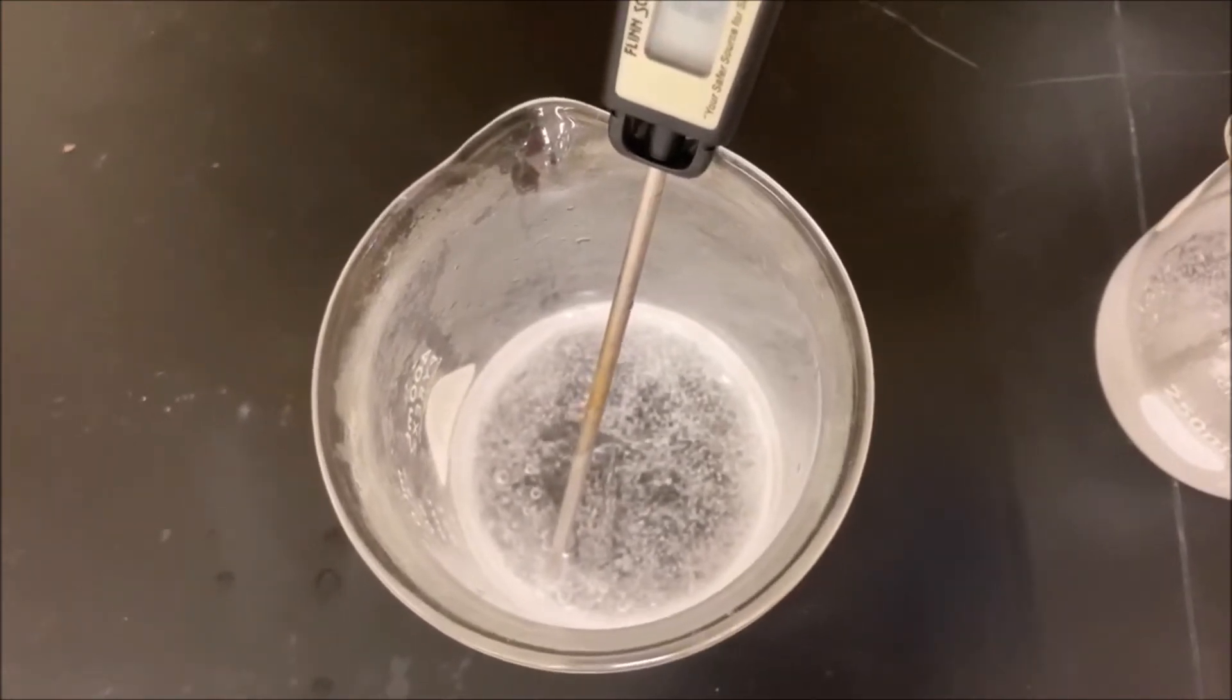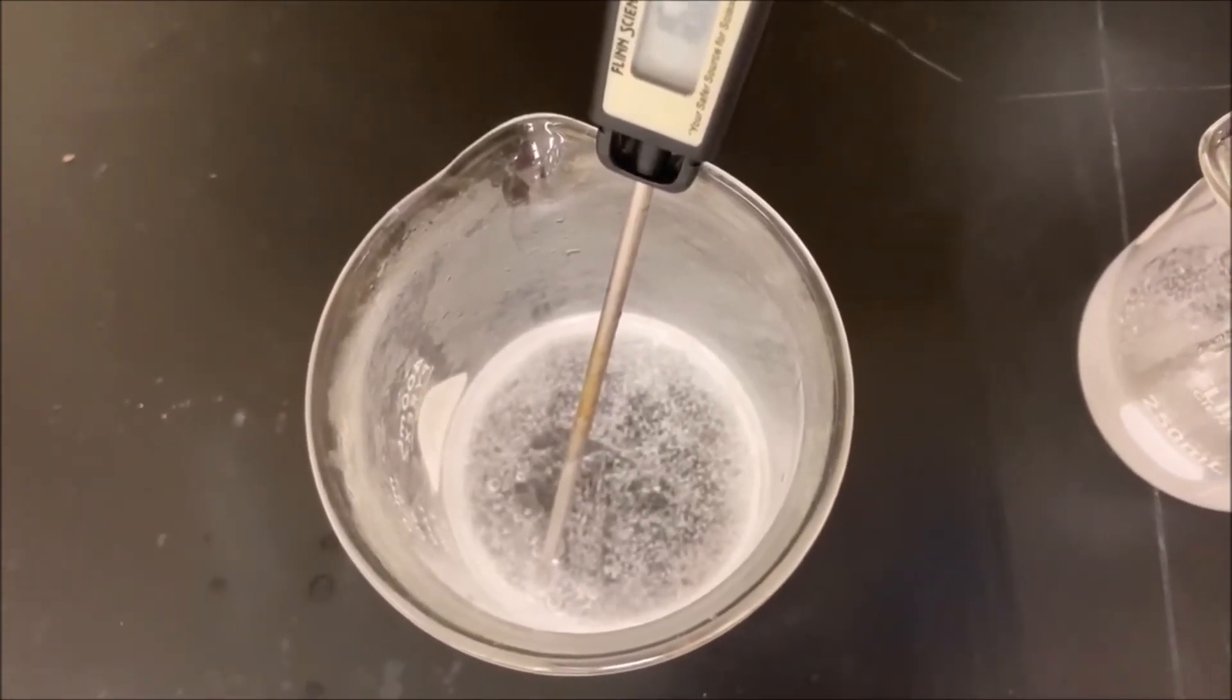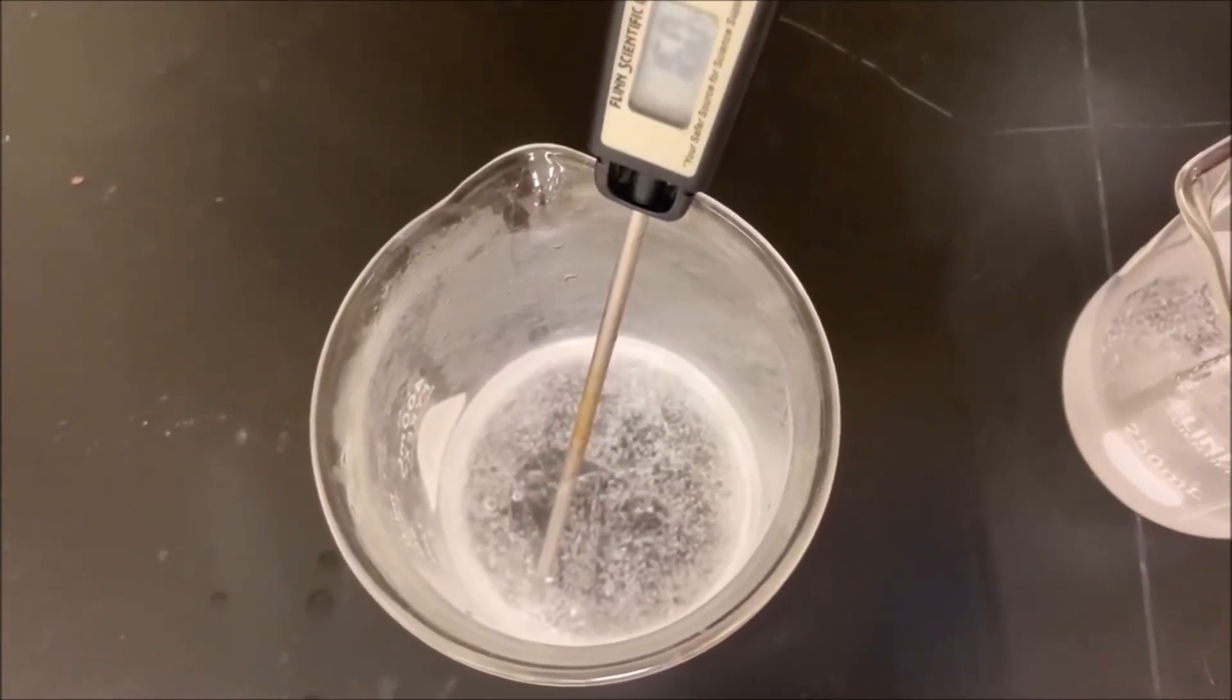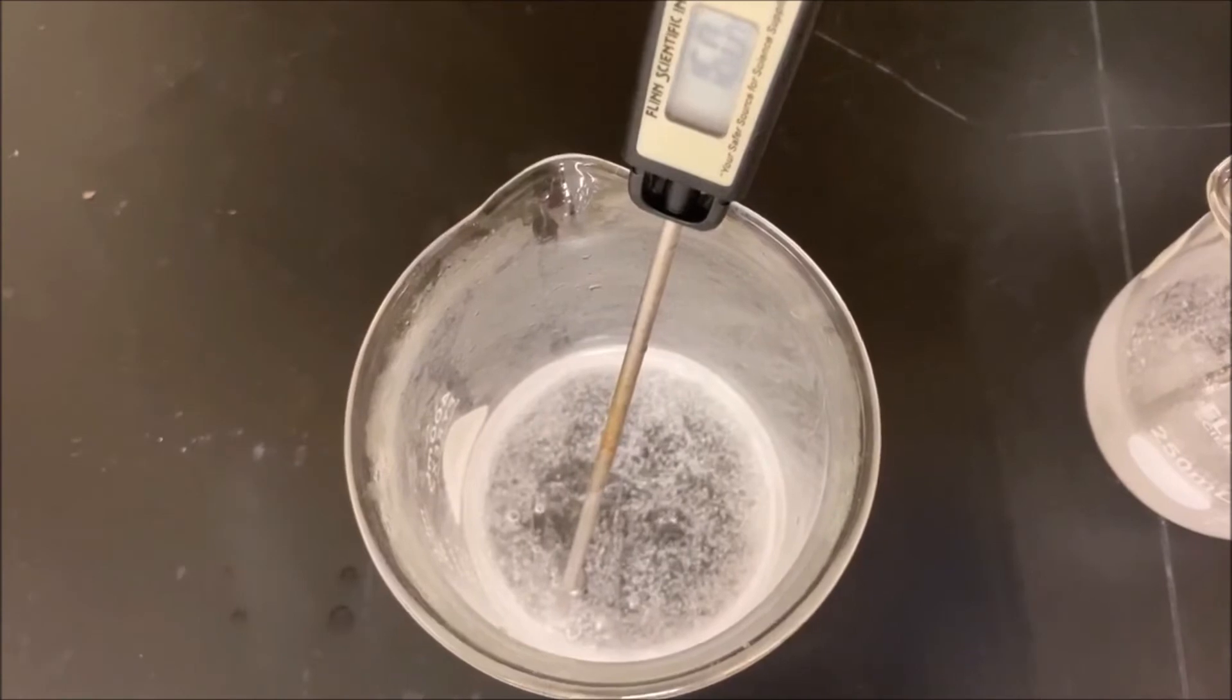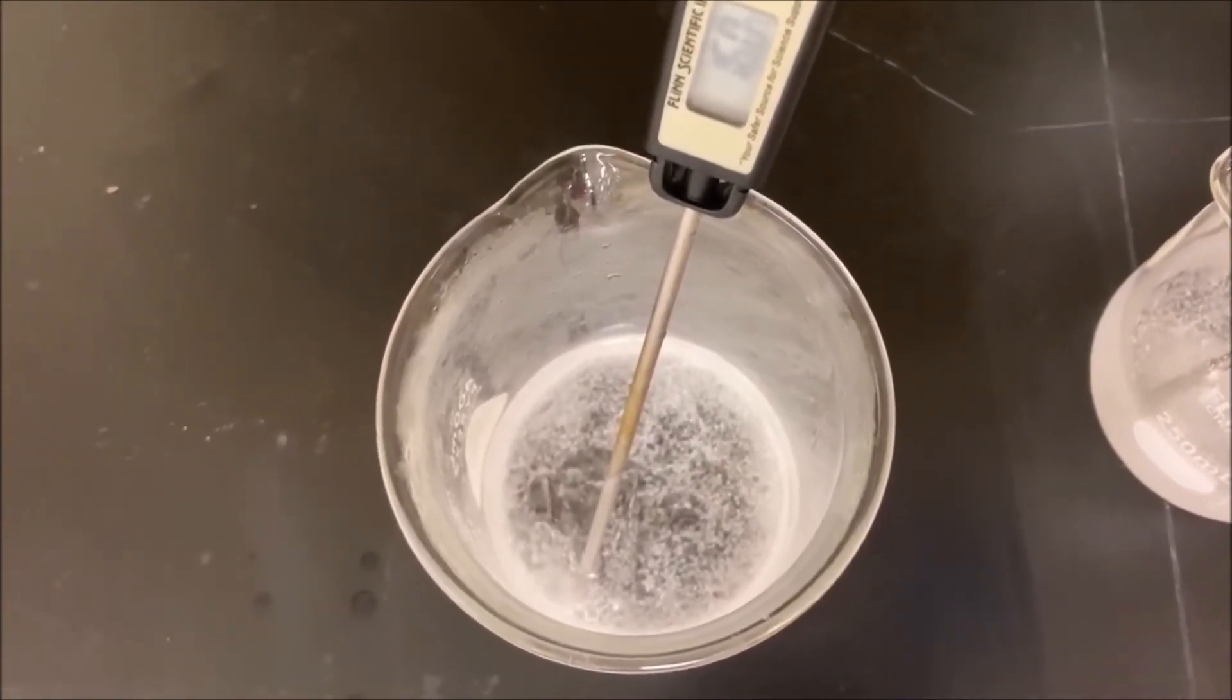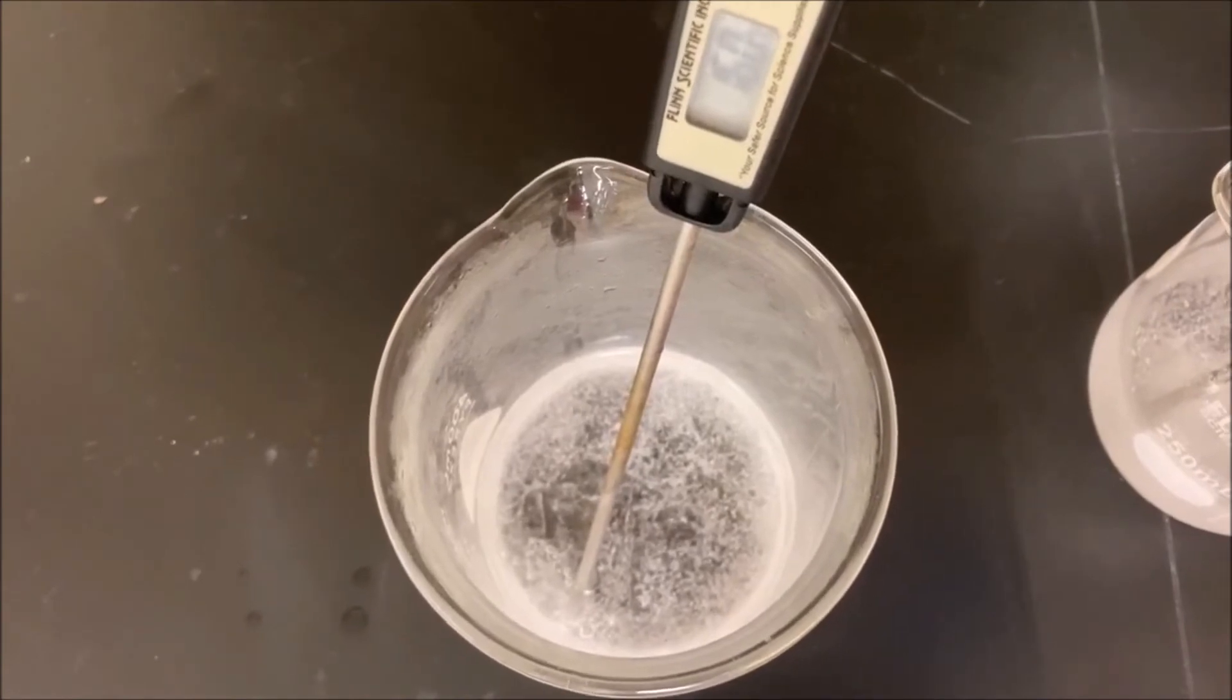So this is a reaction that is endothermic and has an increase in entropy. So at lower temperatures it's not spontaneous. Perhaps we're below that point where that really works. We get a quick flash of reaction at the high concentration and then as things mix it doesn't react anymore. That's fascinating.